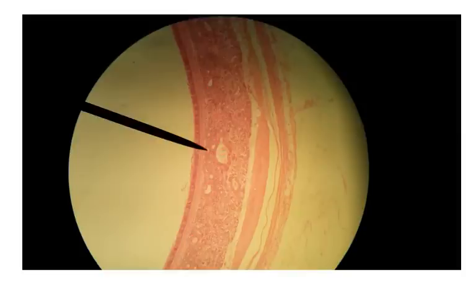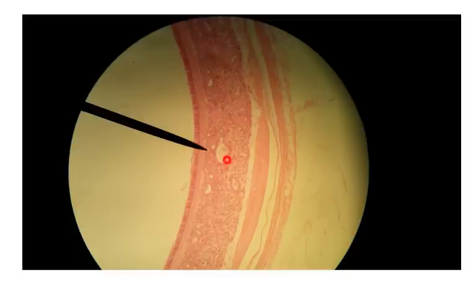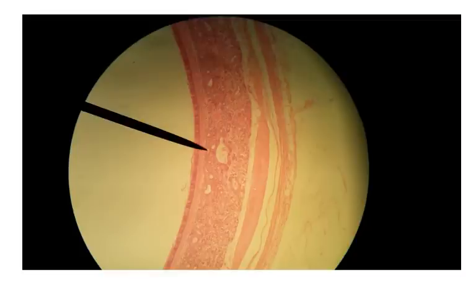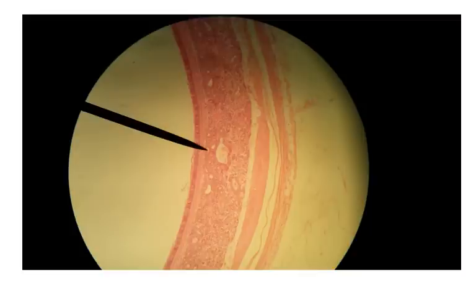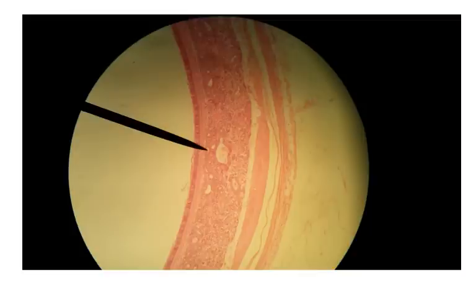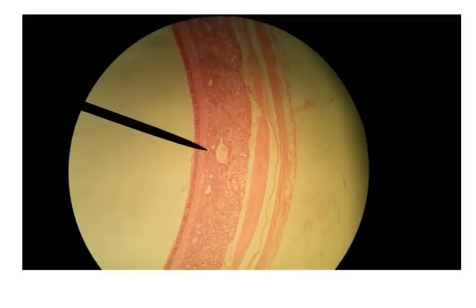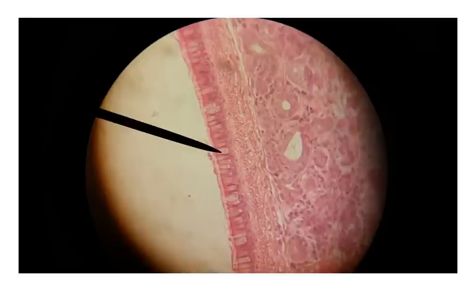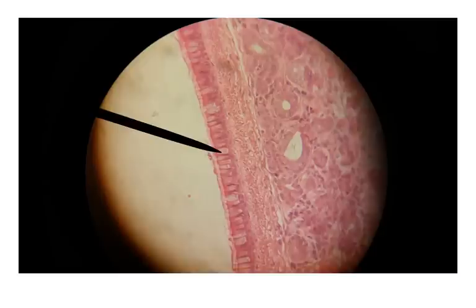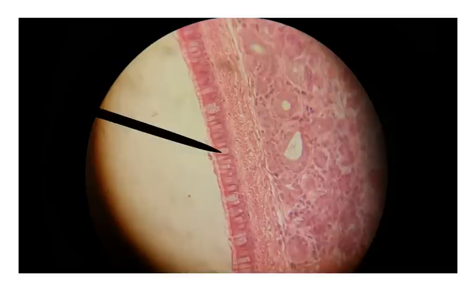These open areas here are called mucous glands, mucosal glands, or seromucosal glands. They secrete some mucus, but we're going to look at something else on the next slide that handles more of the mucus production we're interested in. Let's take the same slide and zoom in a little bit — here again you can see some of those seromucosal glands.